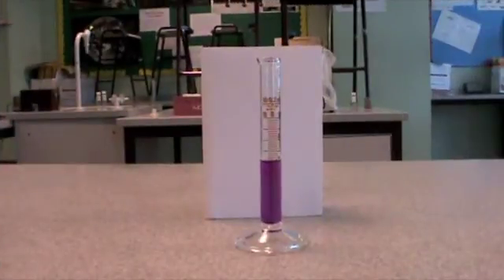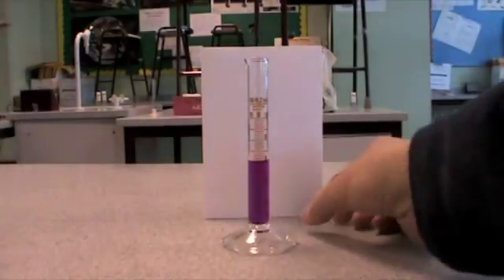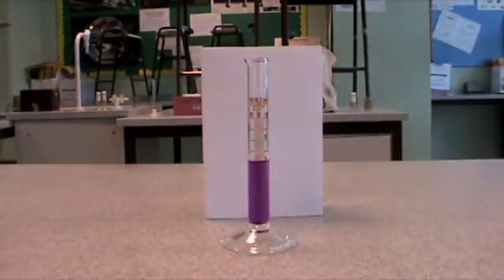To find the volume of the piece of glass, I'm going to put it in some water in a measuring cylinder and see how much the volume increases. So I've got some water in a measuring cylinder here, and I'll put some dye in it so you can see the water. If I get down level with the water so I can measure, I see I've got exactly 6 centimeters cubed of water.